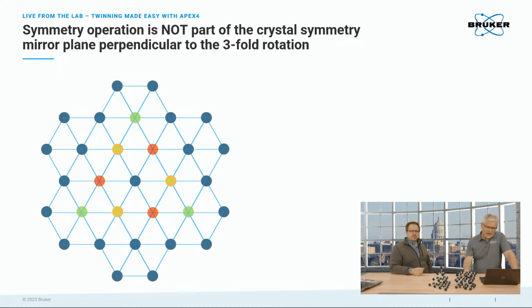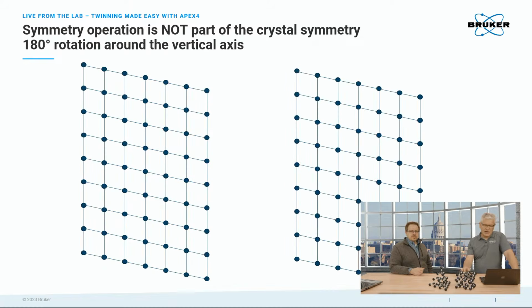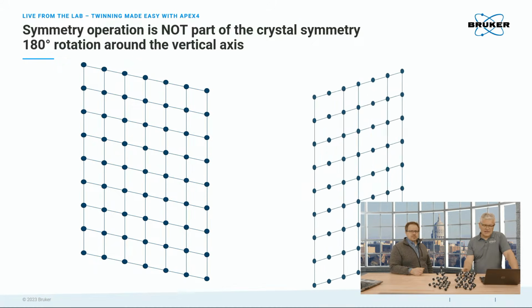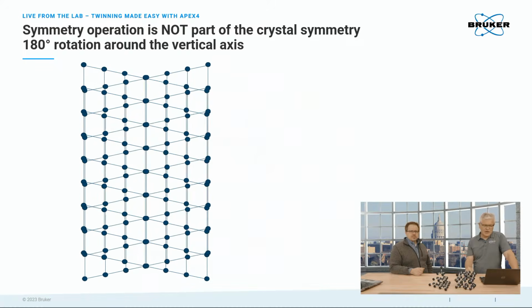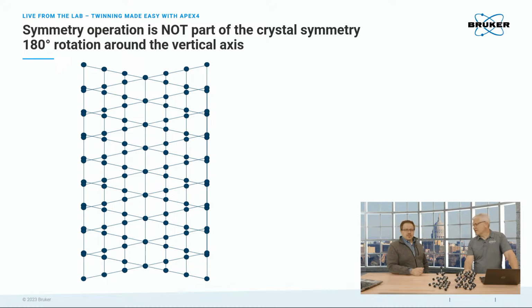Then if we go to lower symmetry, in this case something monoclinic, you see we have an angle that's not 90 degrees. I did a rotation by 180 degrees. When we overlap them, you see we have sort of a mess. Certainly, especially if you didn't have the lines there. Exactly, and unfortunately, when you look at diffraction patterns, the software is not good enough to overlay lines right away. That's basically what you get from indexing.